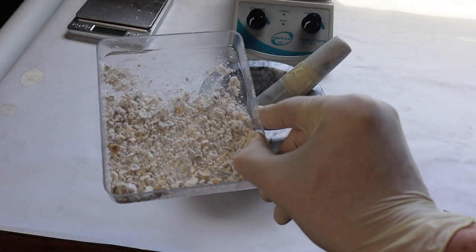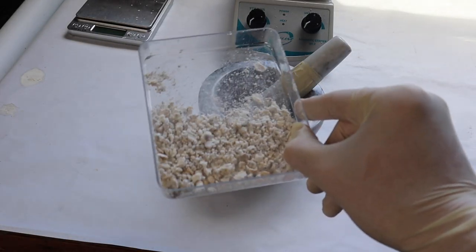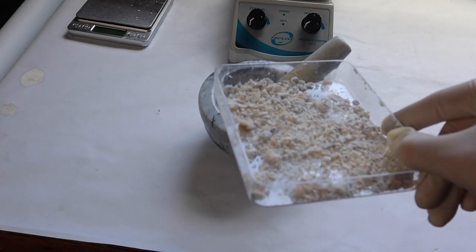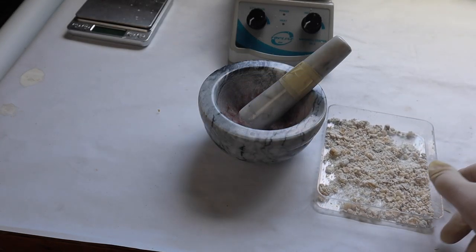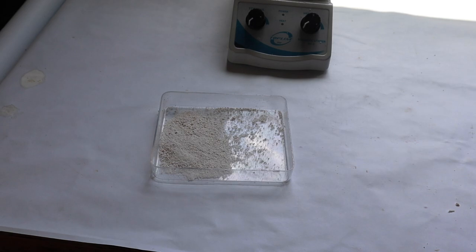This calcium acetate is relatively impure because I extracted it from Tums. So first I'm going to crush it up into a fine powder.